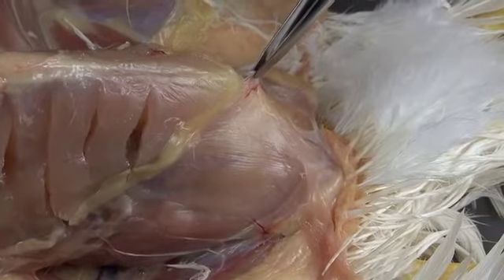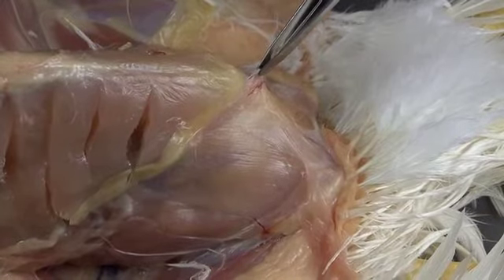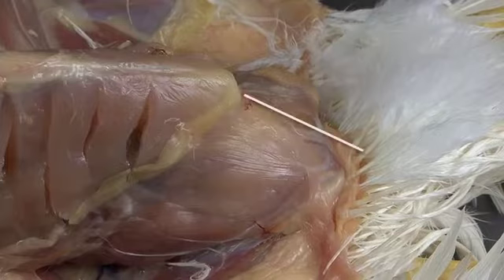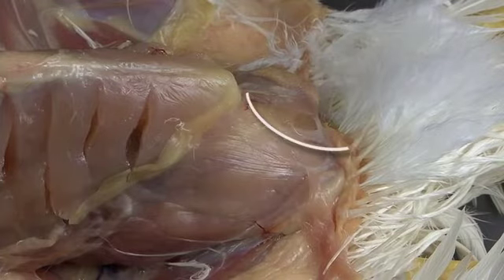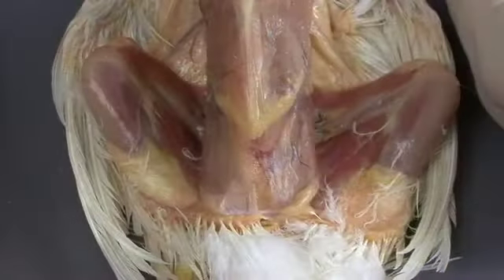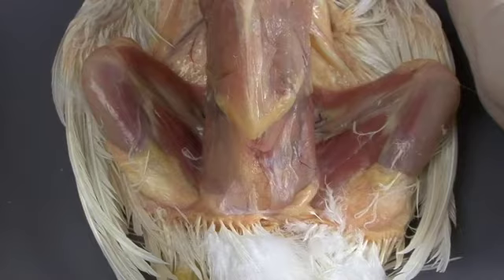The body wall of the bird is very thin. When compared to the level of the keel, the body wall should be flat or concave. Note any bulging, which could indicate the presence of fluid in the coelomic cavity. If the bird is in good body condition, the peritoneum may enclose a thick layer of fat in the posthepatic septum.